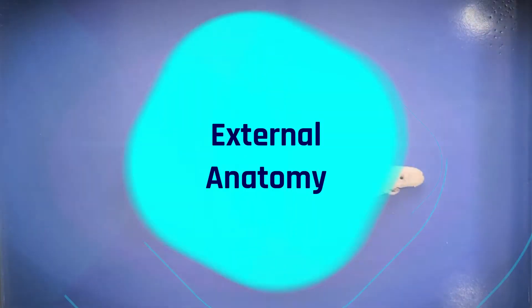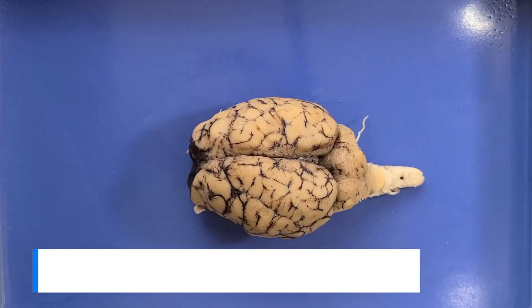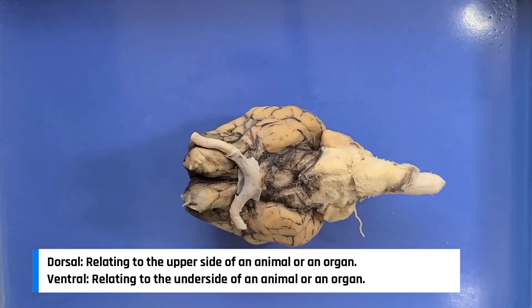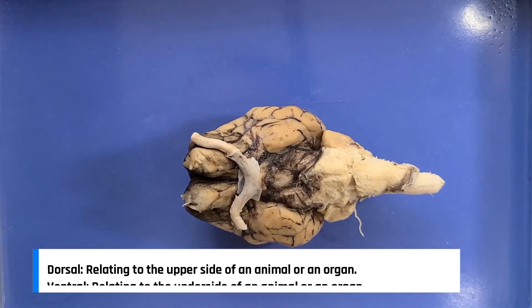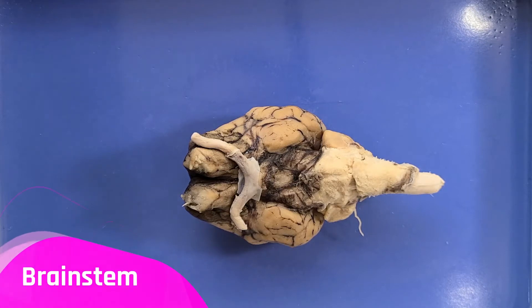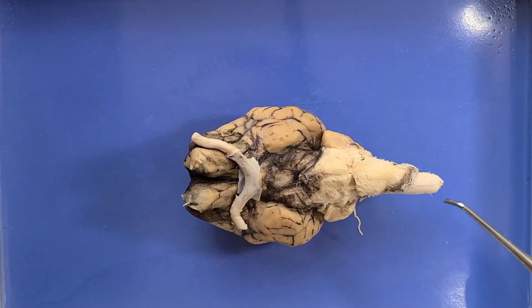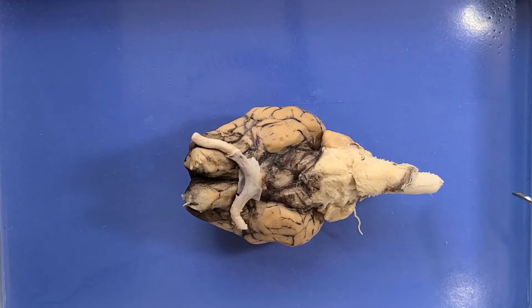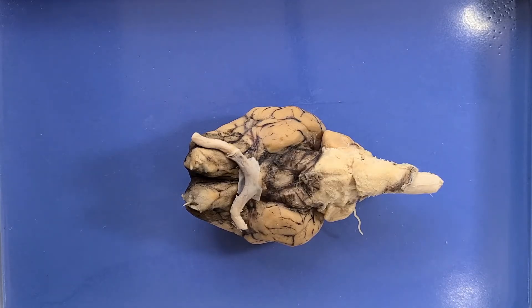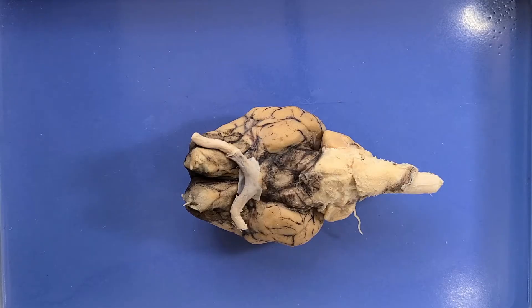So first let's take a look at the external anatomy. This here is the dorsal surface, and when I flip it over, this is the ventral surface. On the ventral surface you can see the brain stem, which is located at the base of the brain and extends down towards the spinal cord.